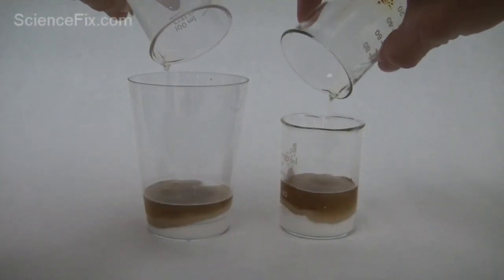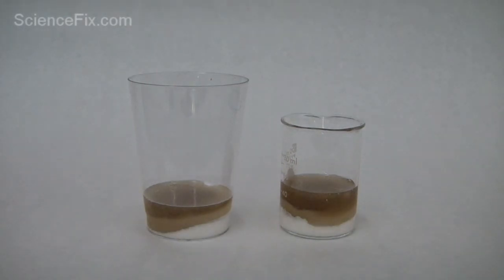A chemical reaction is going to take place. It takes place in several different kinds of steps, and the first sign that a chemical reaction is taking place is the color change. You're going to go from that amber and white colors of the two separate chemicals to a darker black color, and this takes place over quite a bit of time. So let's take a look at it.